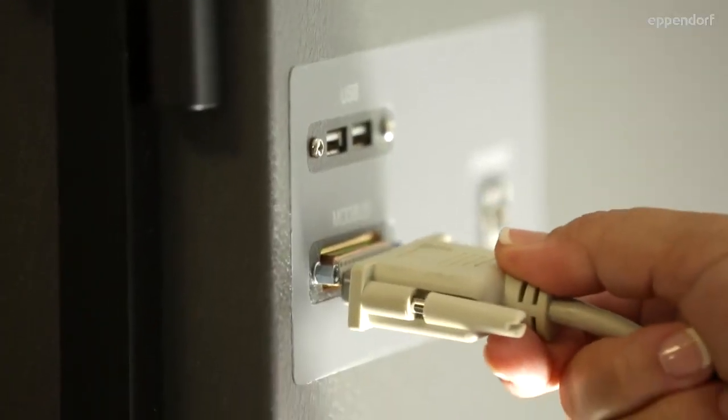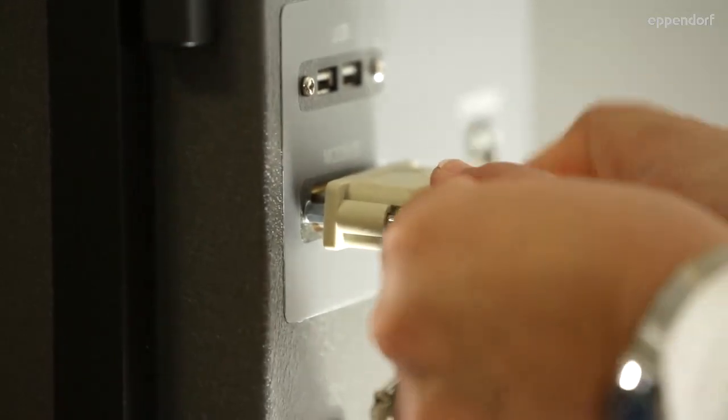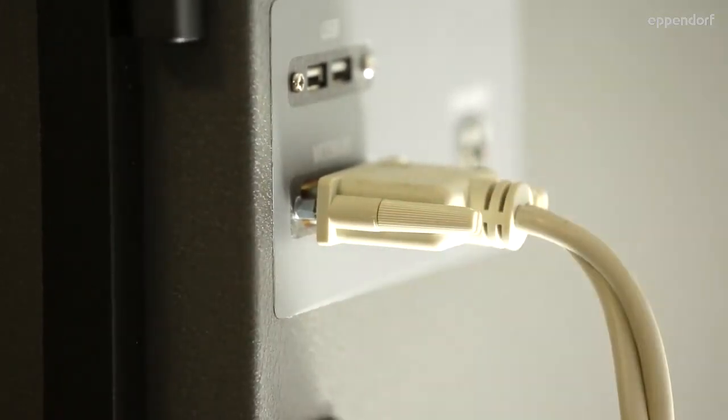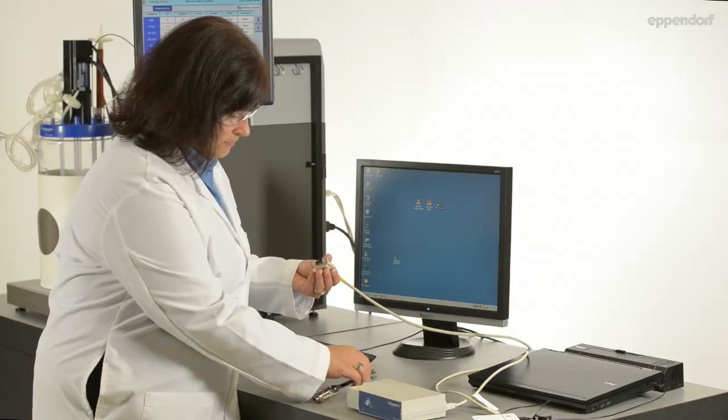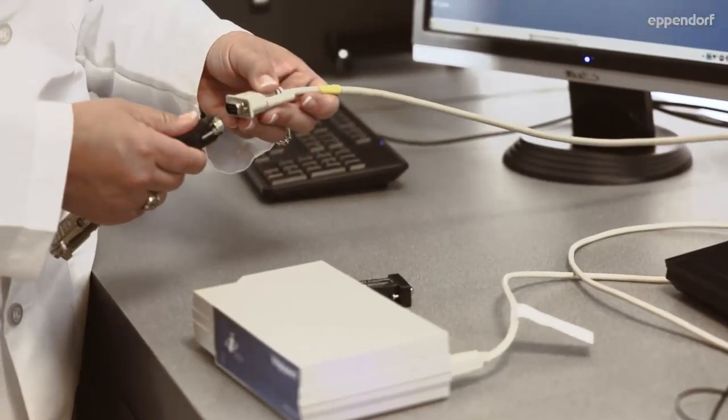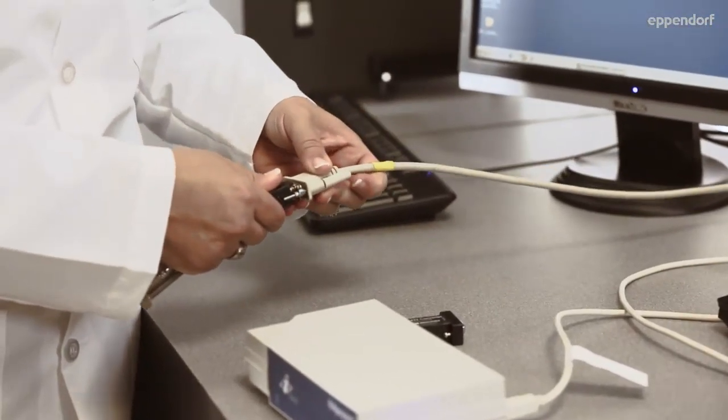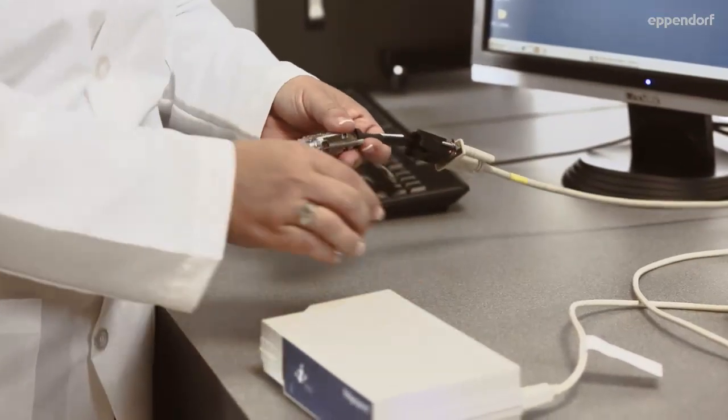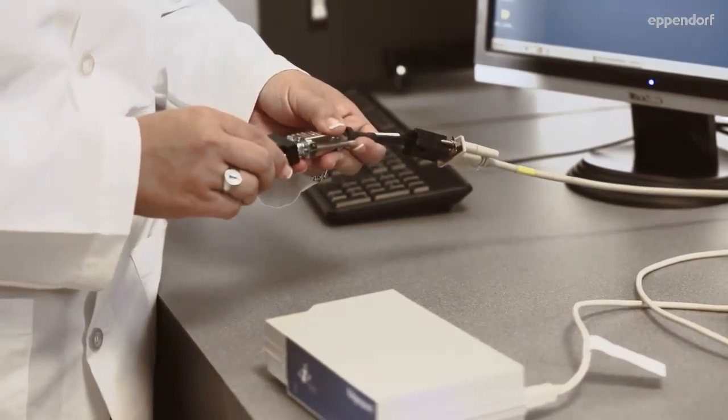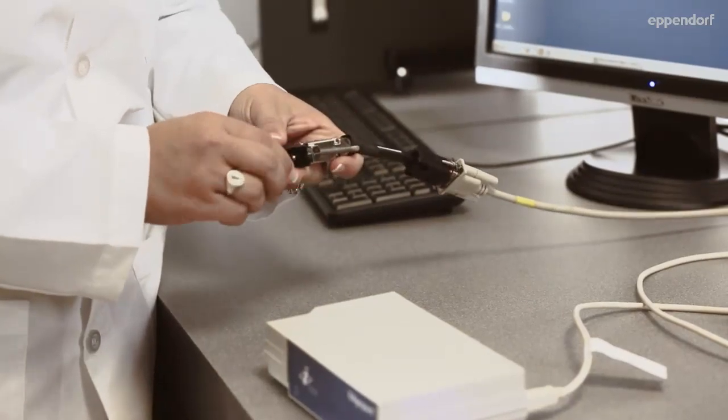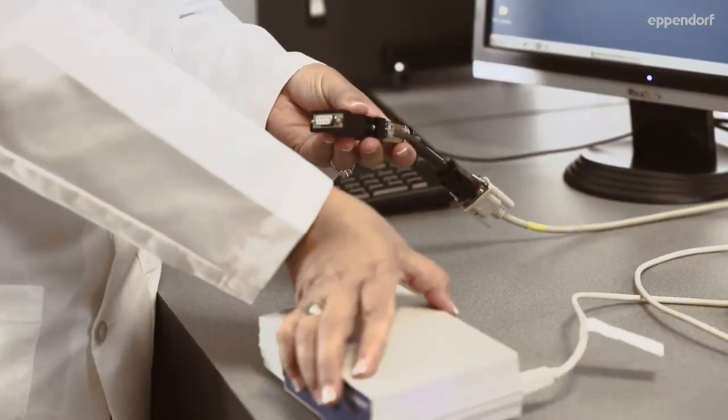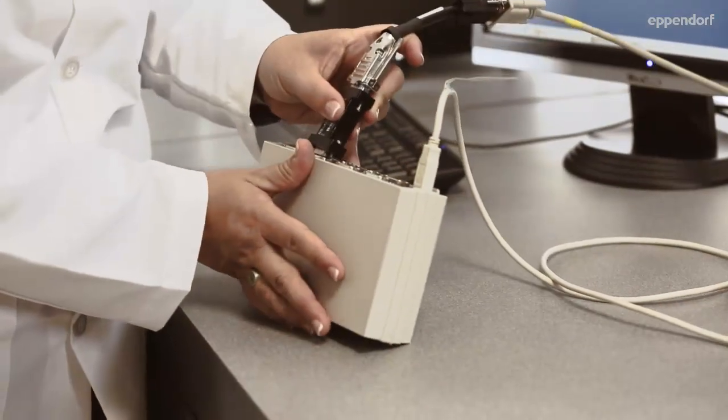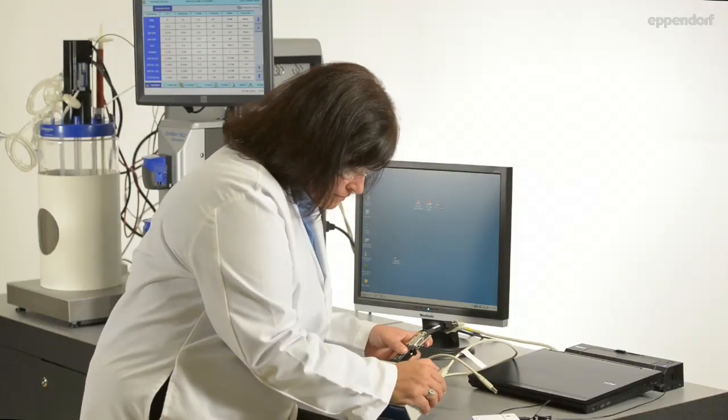First, connect the provided RS422 cable to the BioCommand serial port on your controller. Then, connect the other end of the RS422 cable to the 6-inch BioCommand light cable. The other end of the 6-inch light cable connects to a RS422-RS232 converter, which is also provided with the kit. The converter connects to an interface box, and the interface box then connects to the USB port of the PC.